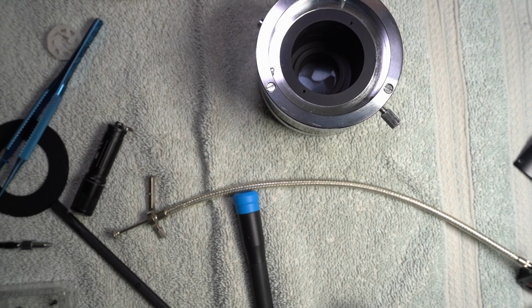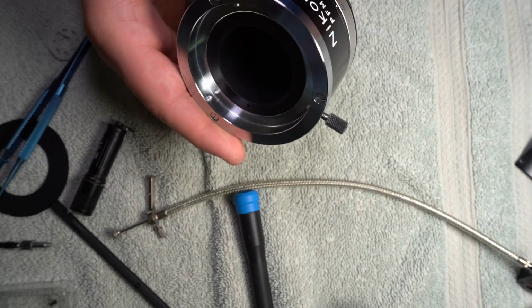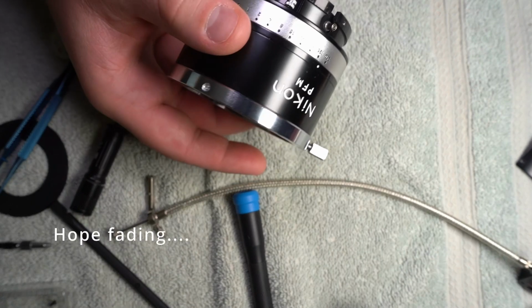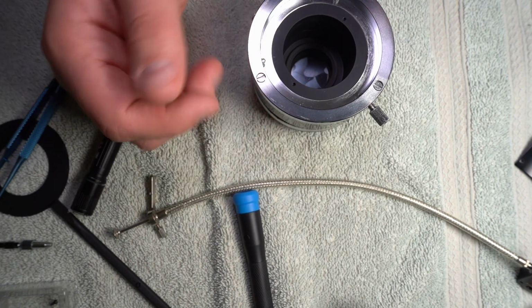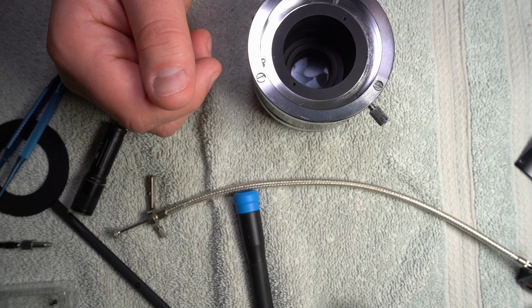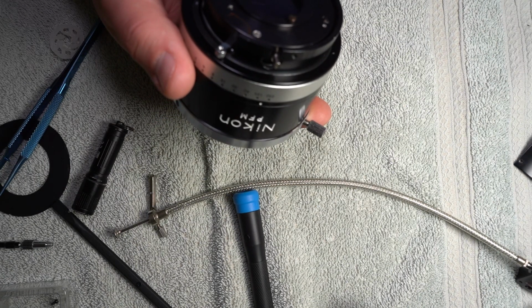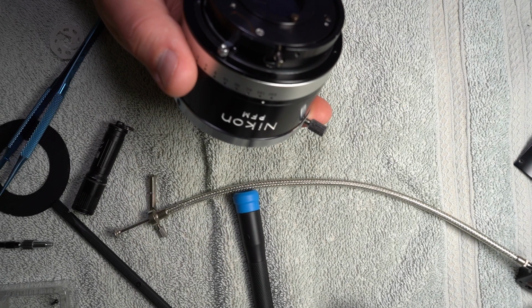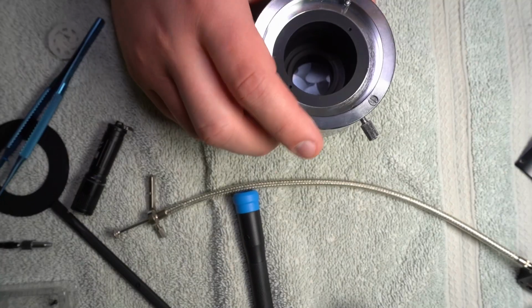Except I don't remember where those two screws go. Well. That's a problem.